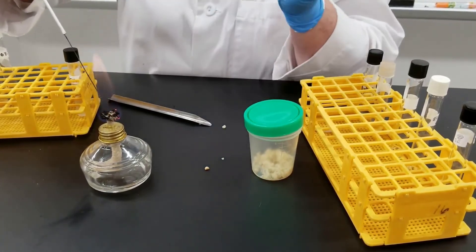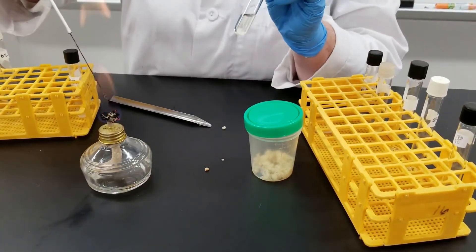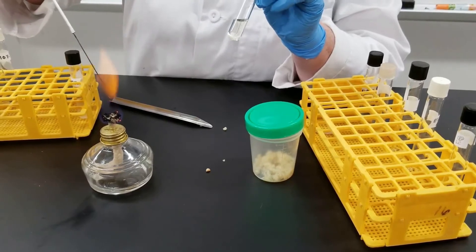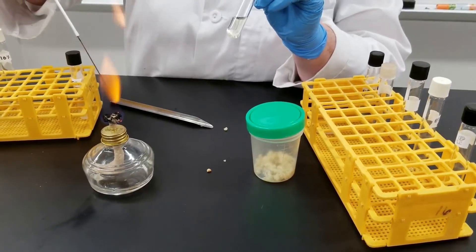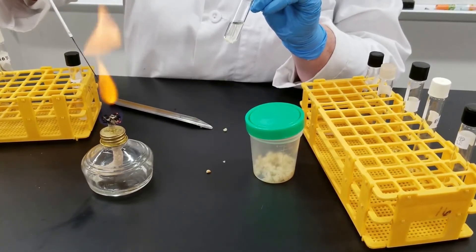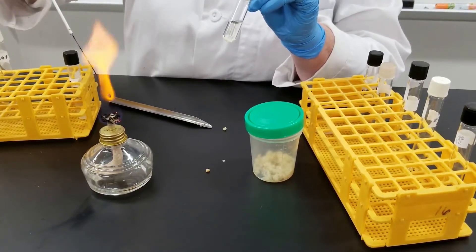If the bacteria is inhibited, it should remain clear. If the bacteria grows in the broth, it will turn cloudy.